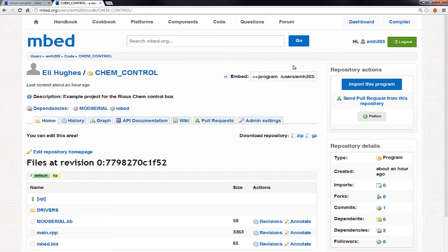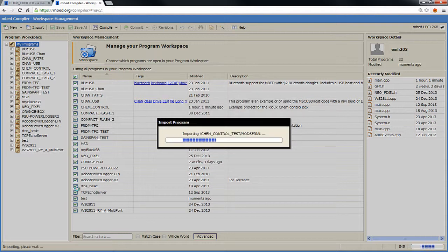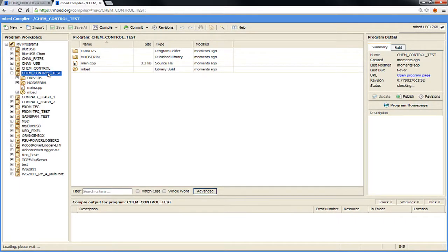But what you can do is we can just go import this program. So it's going to open up the compiler. Let me close this other one. And it asks, what do you want to import? And I'm just going to call this Chem Control Test. I actually have a different one open. You can call it whatever you want. So it's importing, and notice it shows up right here. Here is the one I've been doing development on. Here's like another copy of it.